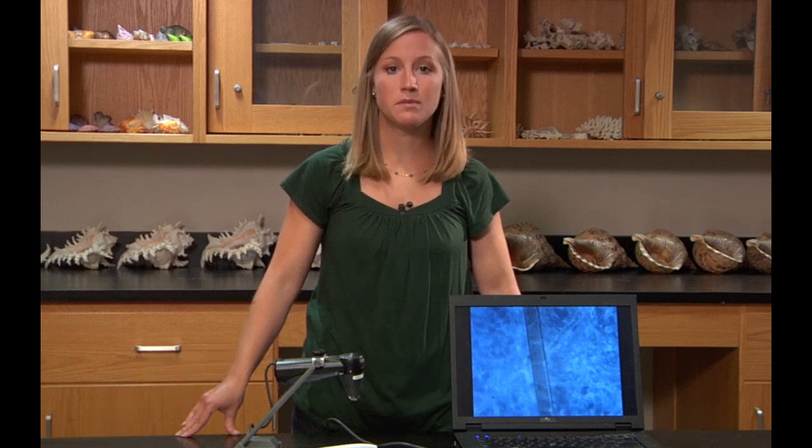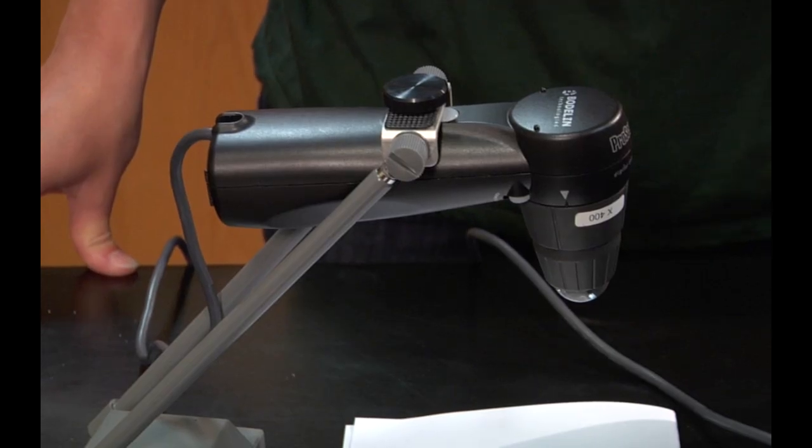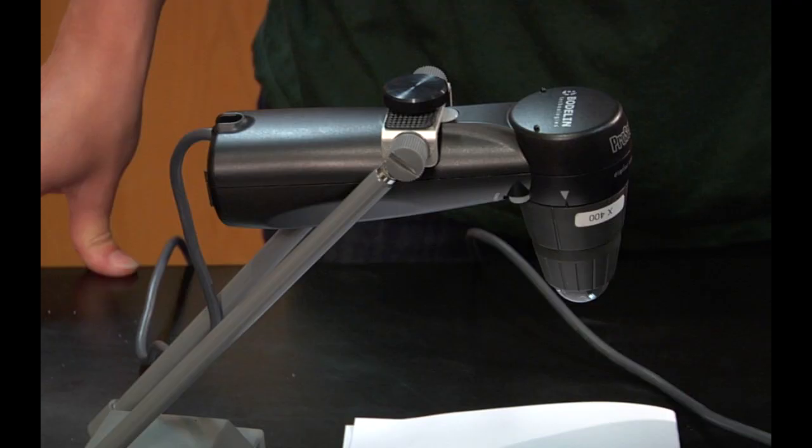In this lesson, you will learn the basics of visual identification of hair and fiber evidence. We're going to be talking about the different shapes and patterns of hairs and fibers, and how to analyze these microscopically. I'm going to be showing you some examples of microscopic images using a ProScope HR digital microscope, which links the images directly to my computer screen. This piece of equipment is commonly used by forensic scientists.